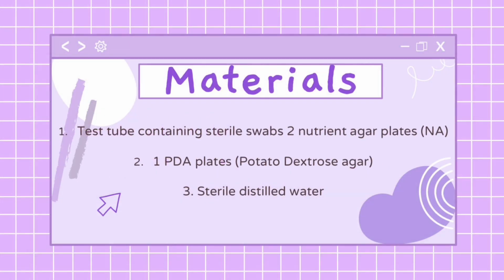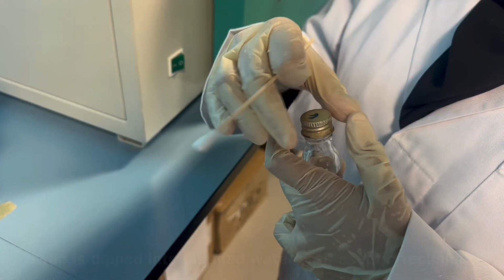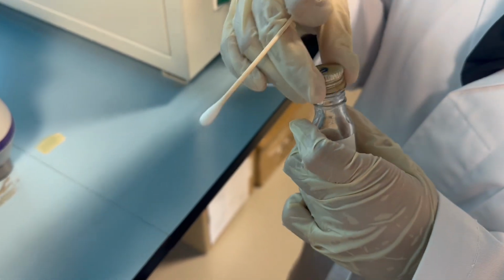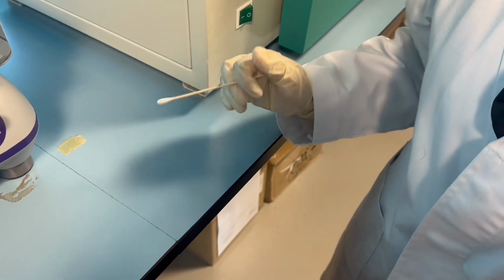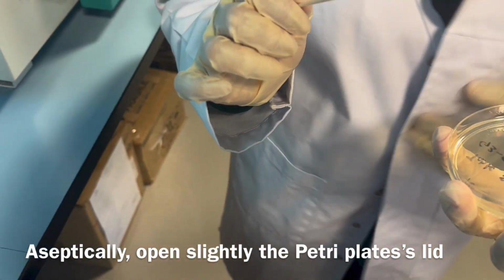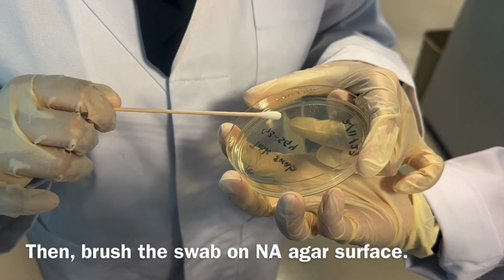So moving on, here are the materials for experiment 1B, microorganisms from environment. So first thing first, we did the table surface. A swab is dipped into the distilled water with aseptic technique. So not too wet, just nice. So the swab will be swabbed on the table surface for 3 times. Aseptically open slightly the Petri plate, then we'll brush the swab on an agar surface.